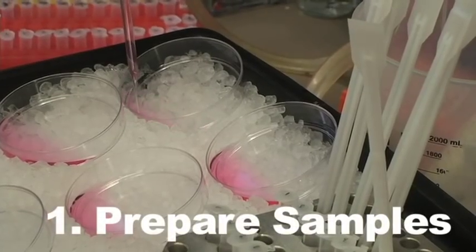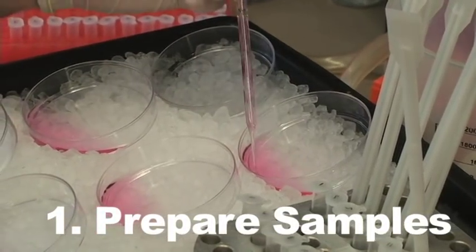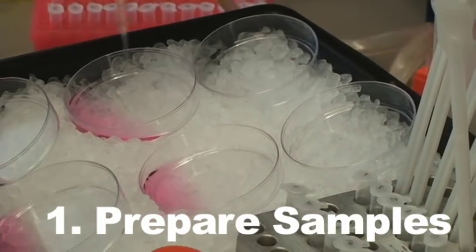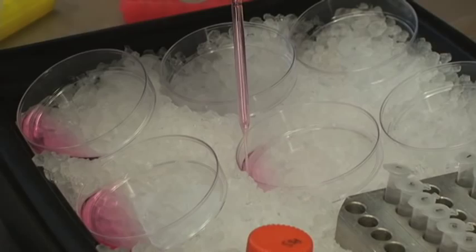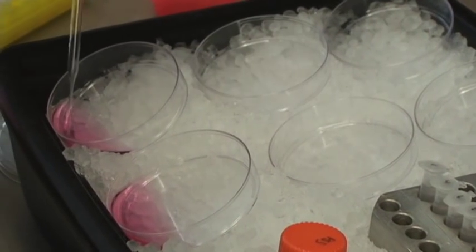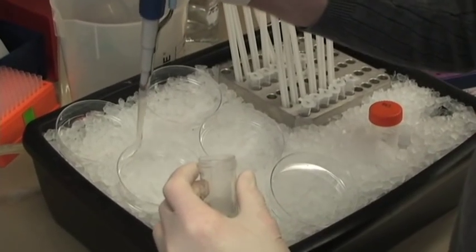Larry has six different samples. They're each mammalian cells that have been engineered to overexpress a different human protein. Larry's removing the media, and then he's going to wash them to make sure all the media's gone before adding lysis buffer.